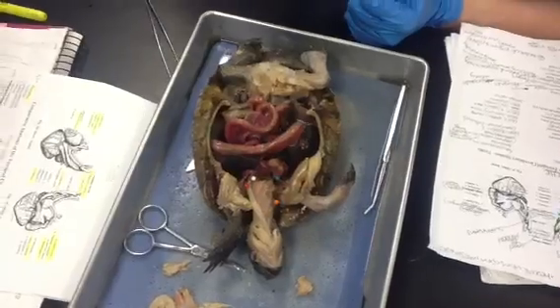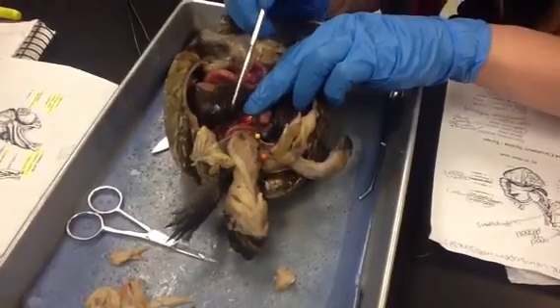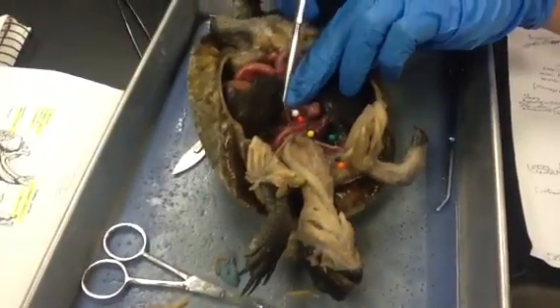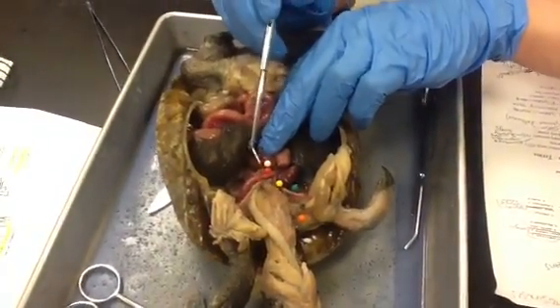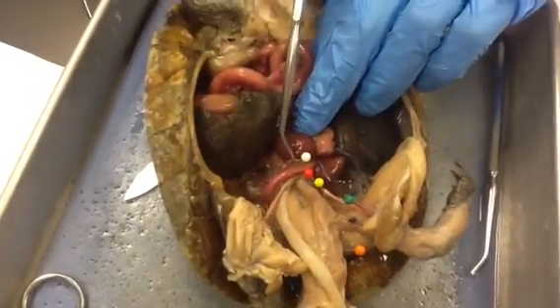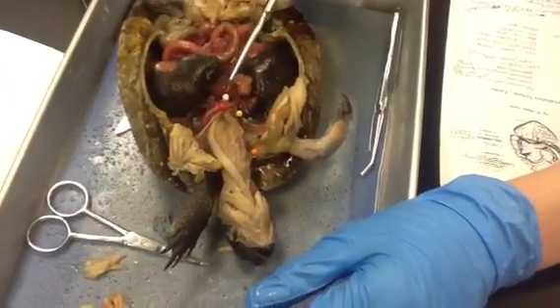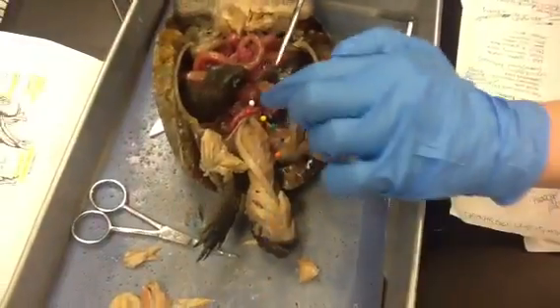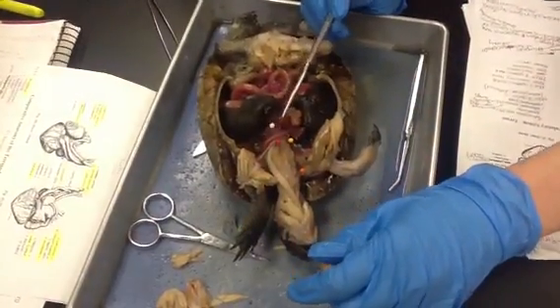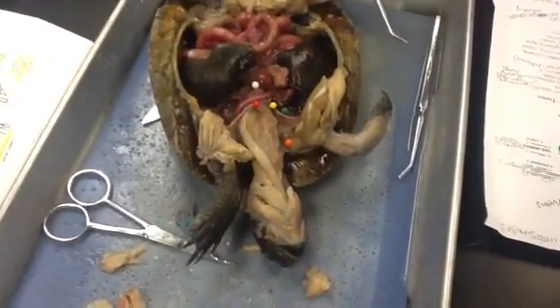The pulmonary arteries — the non-injected ones — lead to the lungs, and it's right here. It's this white pin — the pulmonary trunk. The pulmonary trunk is the white pin, flush almost against the red pin, which is the left systemic trunk, and it's going down to the lungs. The pulmonary arteries are branching off the trunk here. It basically doesn't look like anything almost — it's kind of hard to see the veins coming out; it's not stained. You could follow them down to the lungs. They were supposed to be injected blue.